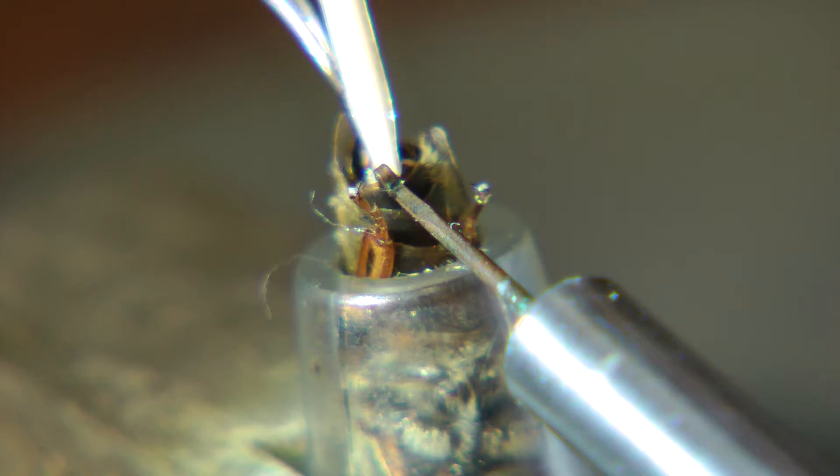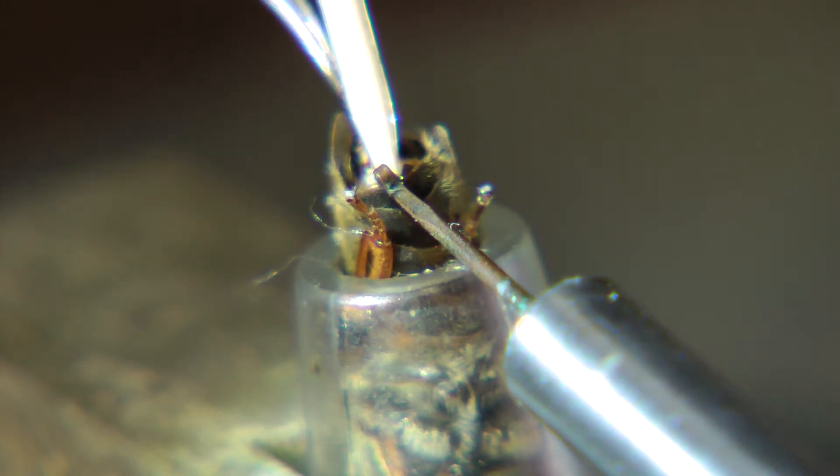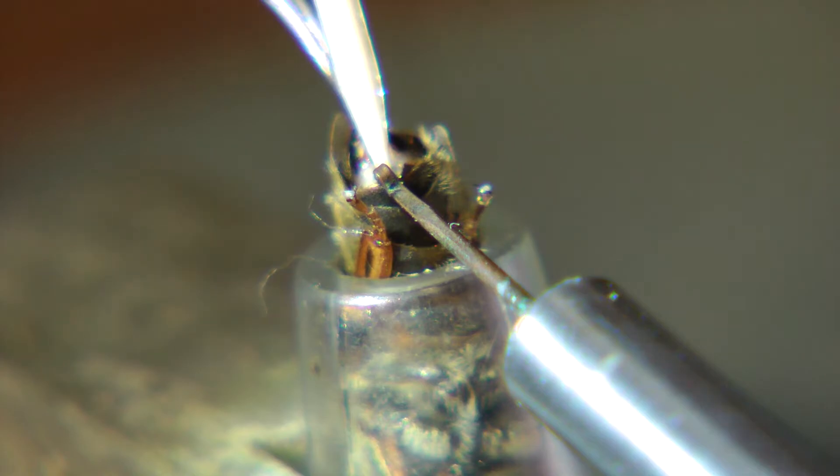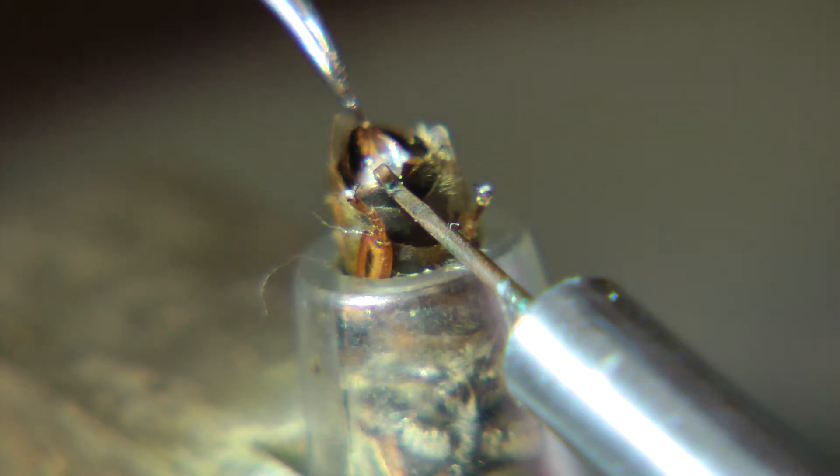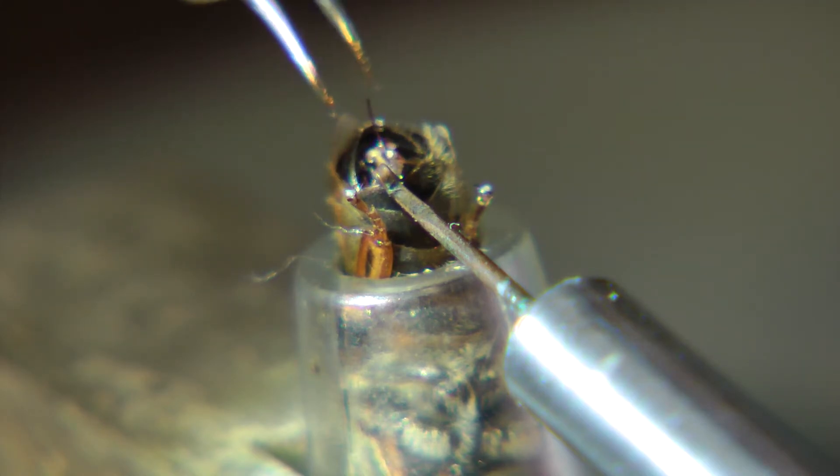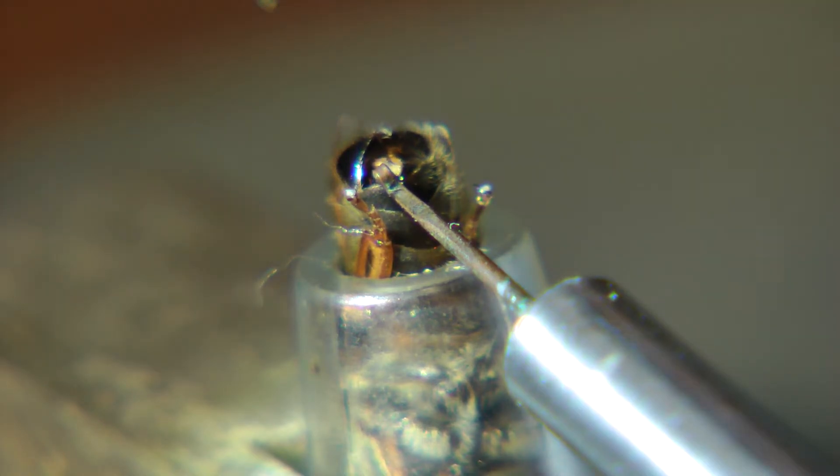He injects about 10 microliters. I think that's it. Okay, I'll back off. Released it. Released her.